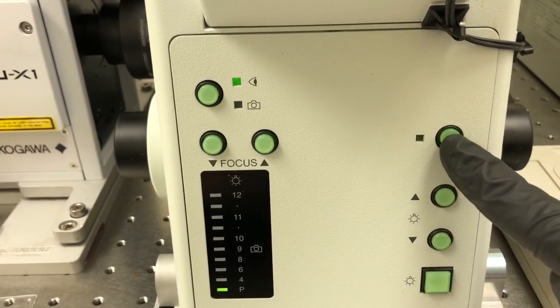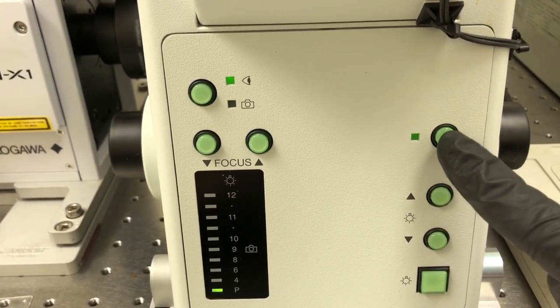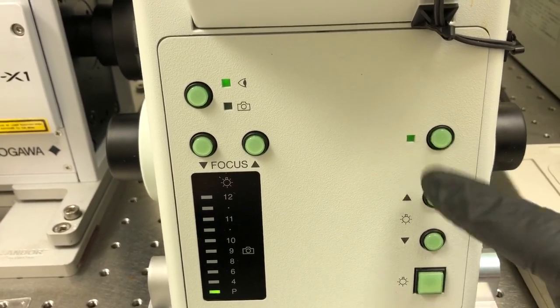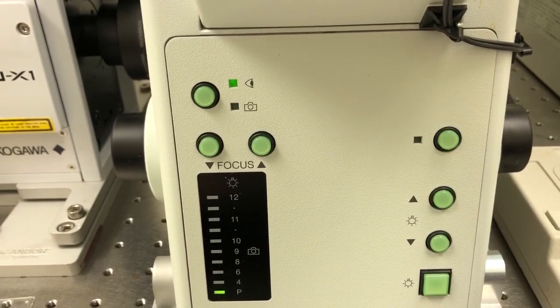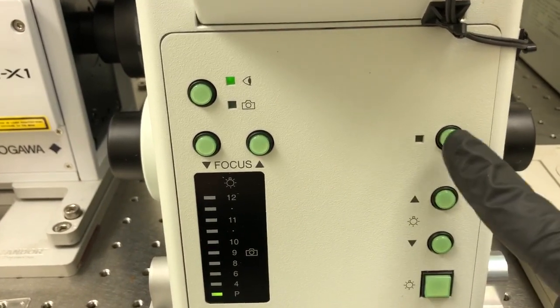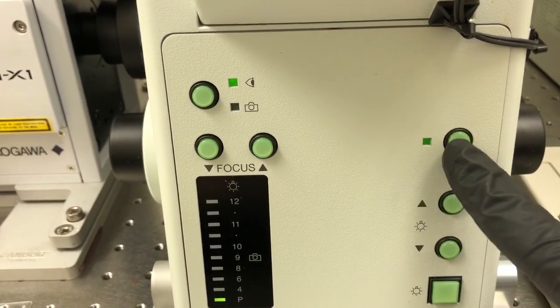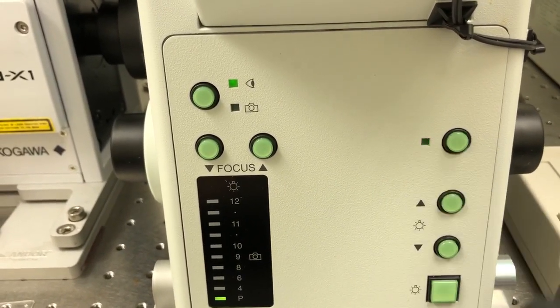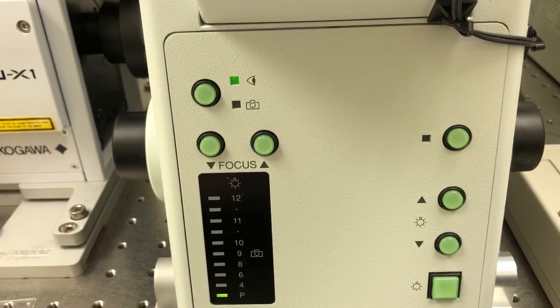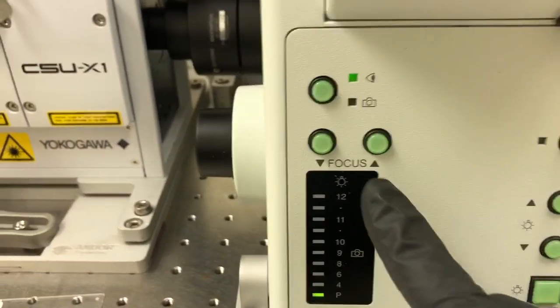This one is equivalent to the toggle between fine and coarse focus mode. When the light is on, that means coarse focus is engaged. When the light is off, it means fine focus is on.